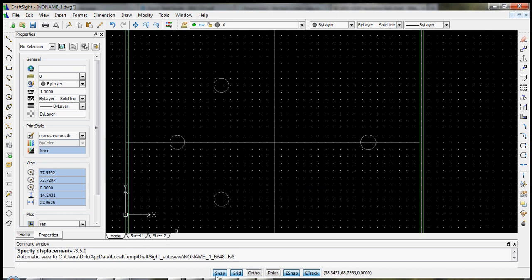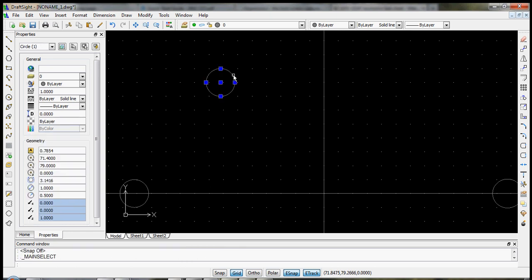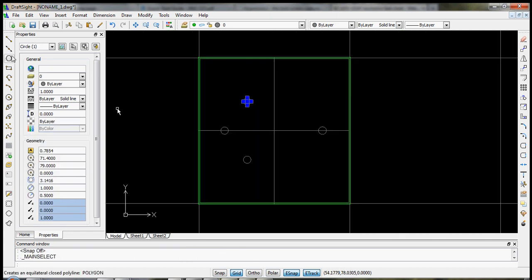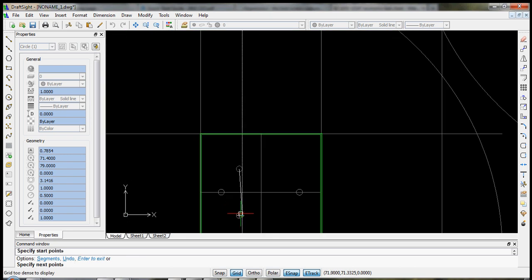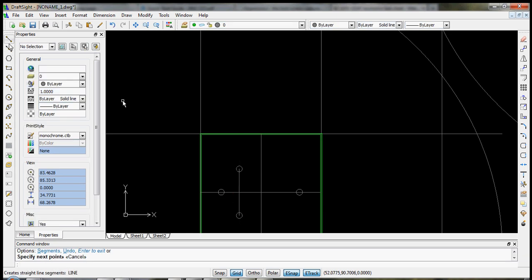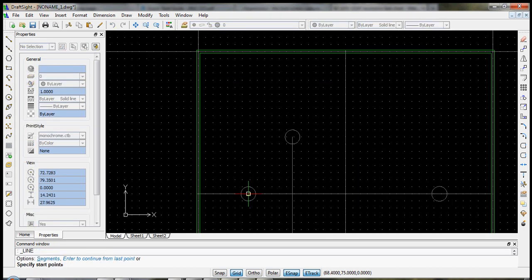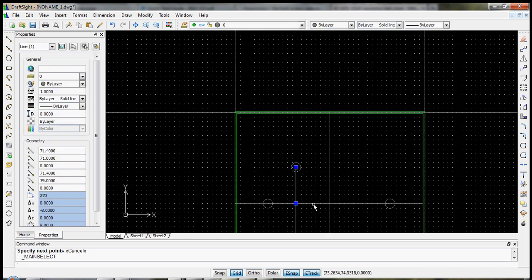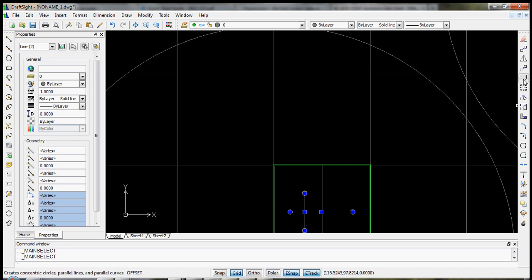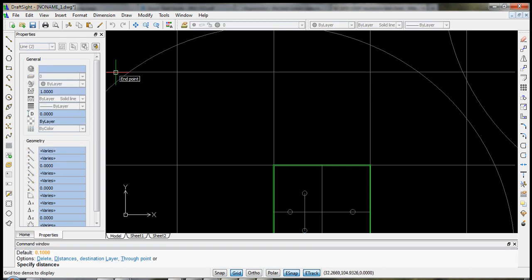Okay, I'm going to turn my snap off now. And now what we're going to do is draw some lines between the centers of these elements. And we want to offset them to give them some width. Let's select both of them, offset.